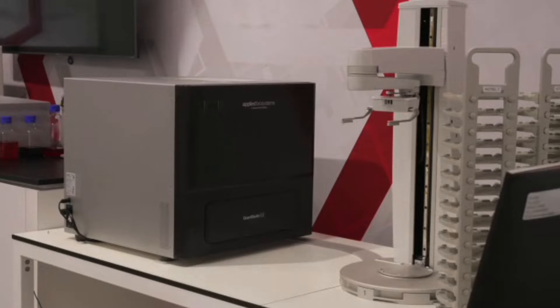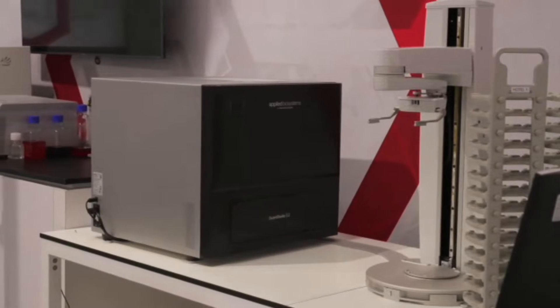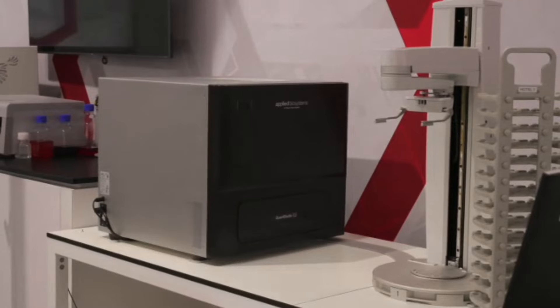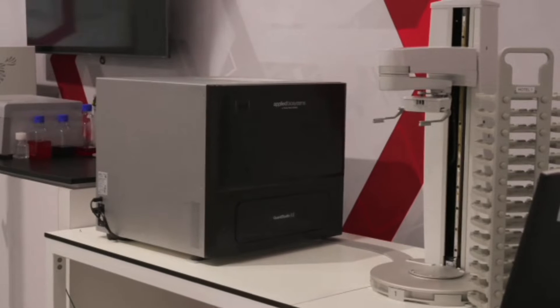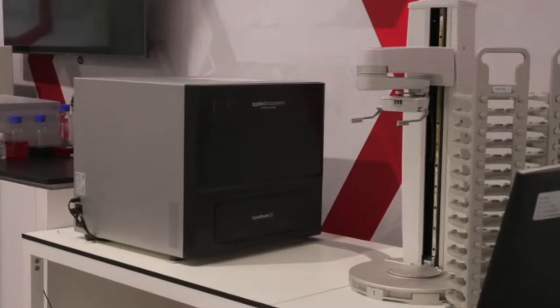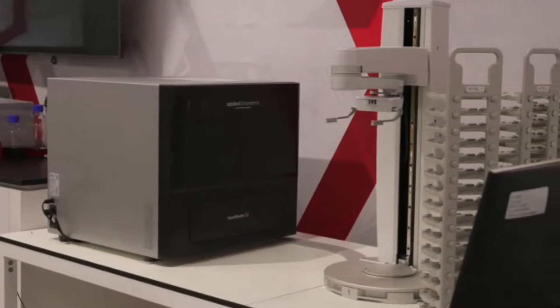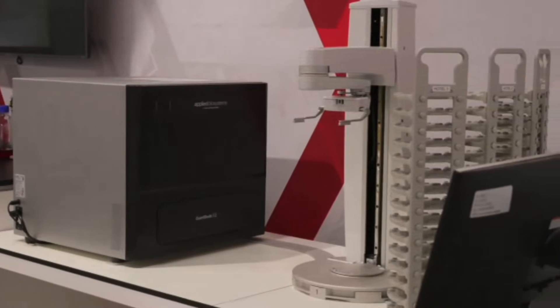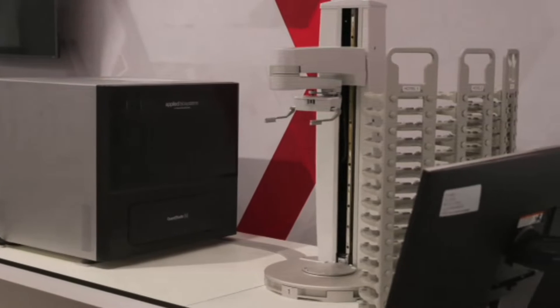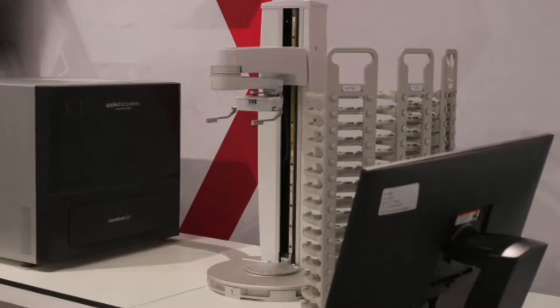A little tip here: what you're seeing on the side is an automated system. We've now launched the Quant Studio Q auto run. If you're interested in automation, we can always demo that for you when you're ready. So Lab Talk is about tutorials that help you get the best performance out of our products in your lab.